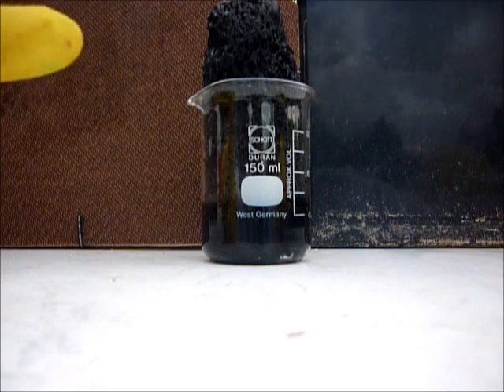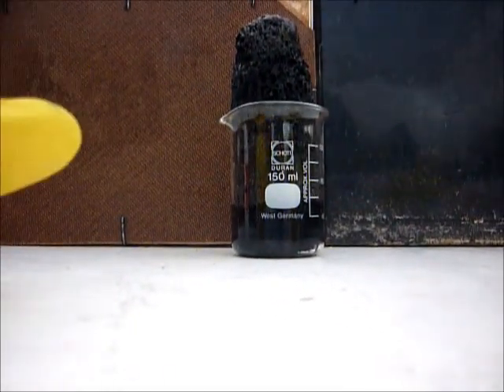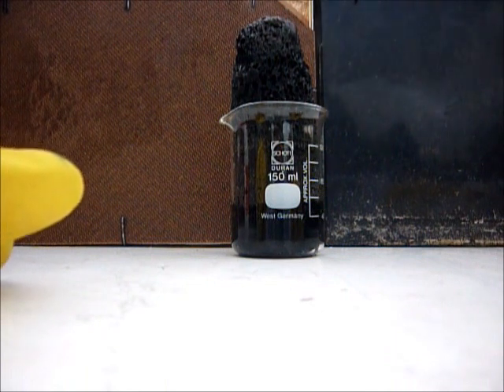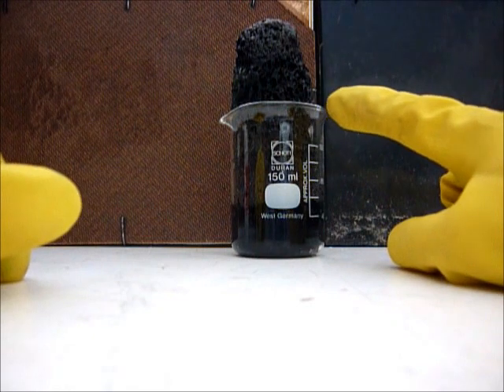It grows. The reaction goes more and more. You see the water here which is condensing and re-evaporating.